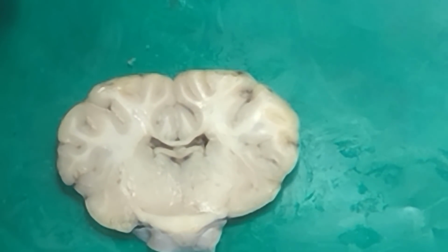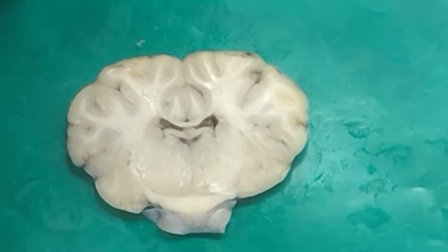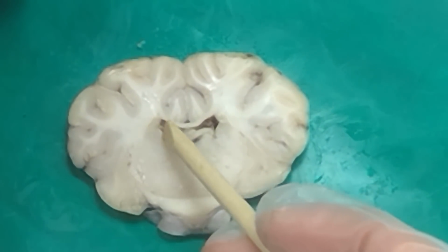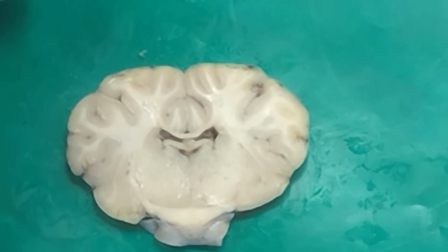Right. The third ventricle is what looks in there? Yeah, the third ventricle. Once you start getting to the third ventricle, then you know you're moving into where you're at the thalamus. You're no longer in basal ganglia where you're going to see the putamen or the globus pallidus. You keep seeing the caudate because the caudate's got this really long tail. It keeps going back along that lateral wall of the lateral ventricle. But other than the caudate, which is this guy up here, we don't really see any other parts of the basal ganglia. So the third ventricle is beneath the fornix.